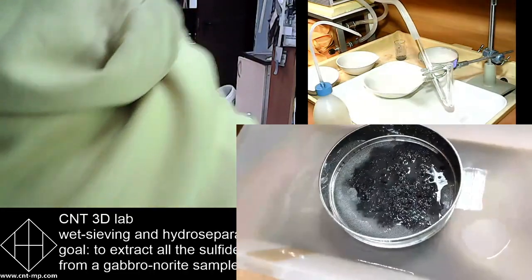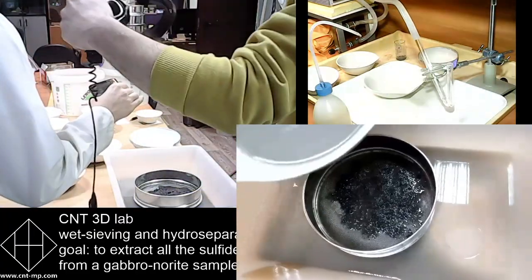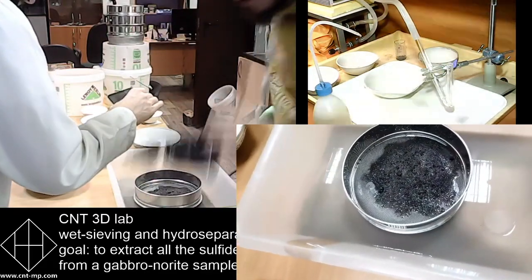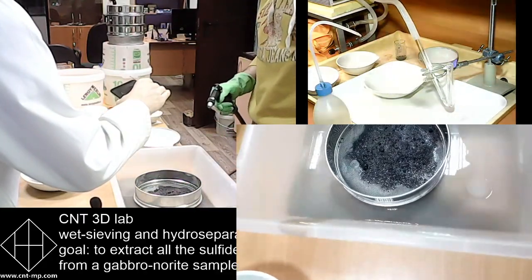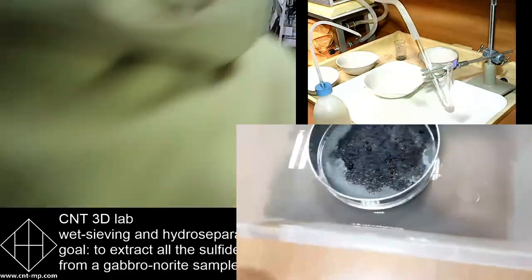So we need to know the grain size. What is the grain size you're using? So this is a Spark 10 product. How much? Okay, so the sieve is -1, so it's 1, right? It's okay. So we go.